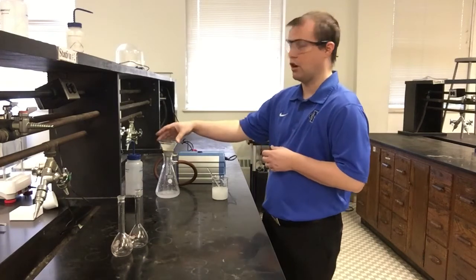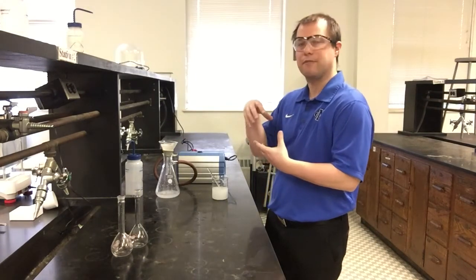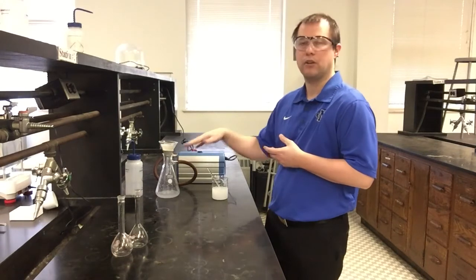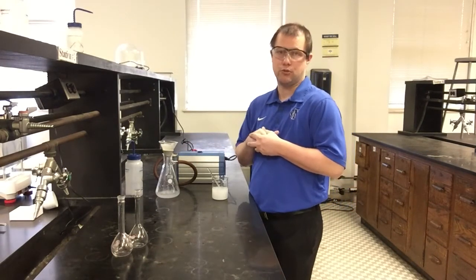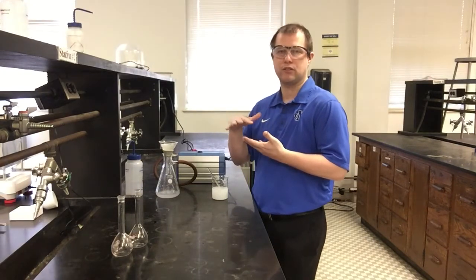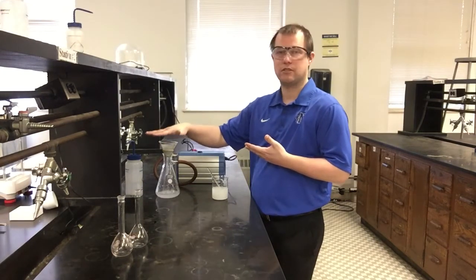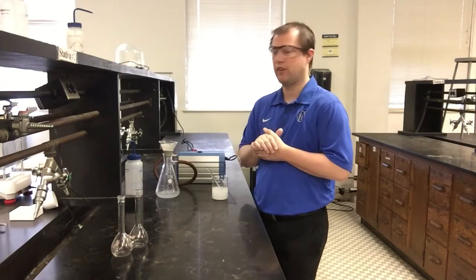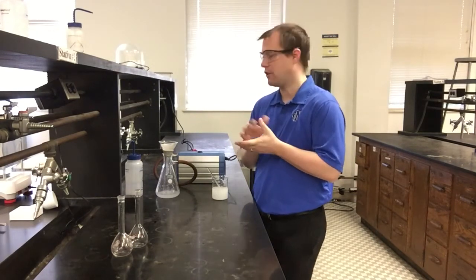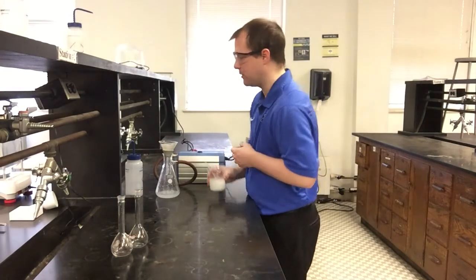Now, there are other funnel setups that are probably nicer for some of this. You can use Buchner funnels, which, instead of a cone shape like this, are almost more like a half cylinder. Those will fit in here fairly well also, and they're pretty good at pulling things through and also drying compounds. The problem is we didn't have any filter paper that would catch this particular solid, because the particulate size is pretty small, so I'm making do with what we have for our funnel and filter paper availability.